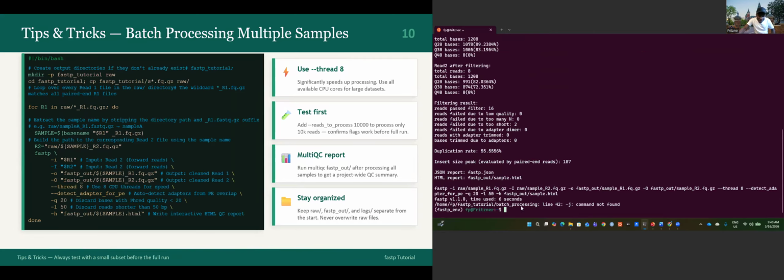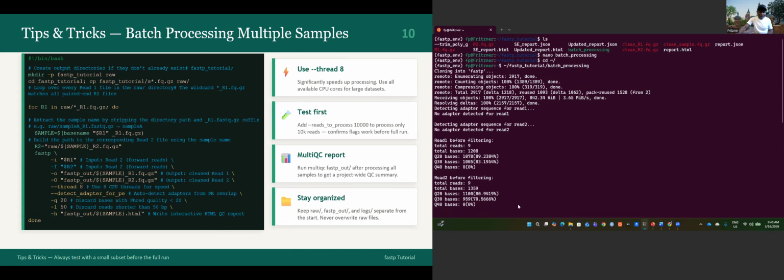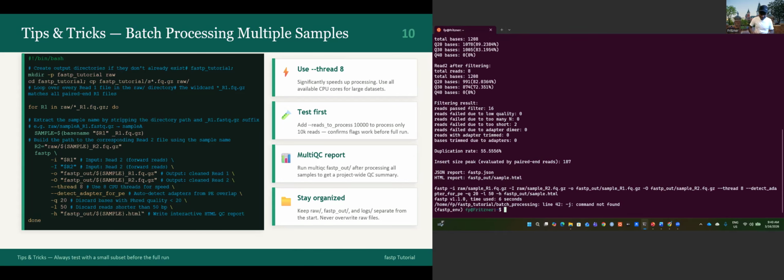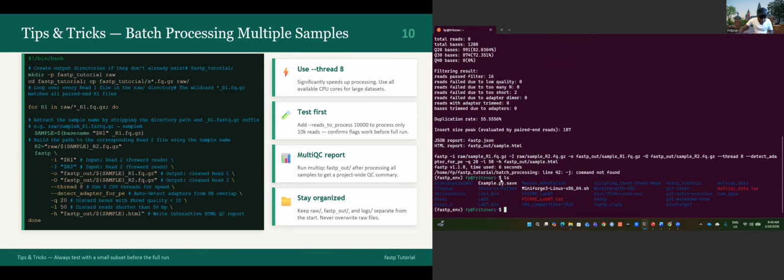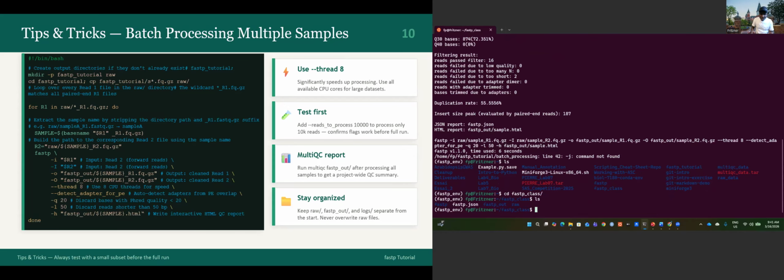Let's go. The first directory created should be the, let's just ls to see. Yeah, I think it should be the fastp class. cd fastp class, fastp, I mistyped. Yeah, inside this fastp class, you have the output and the raw data. This is where we will find the report and everything.